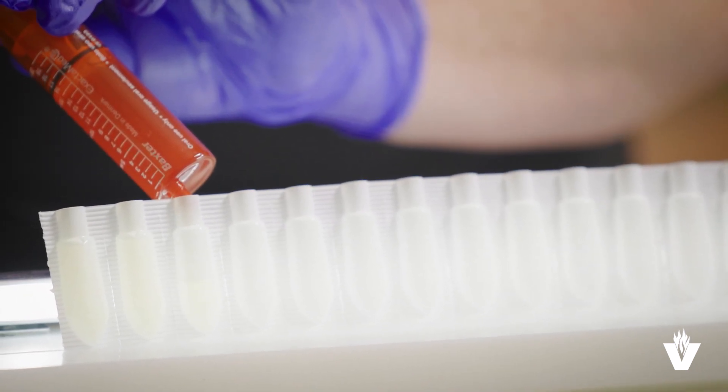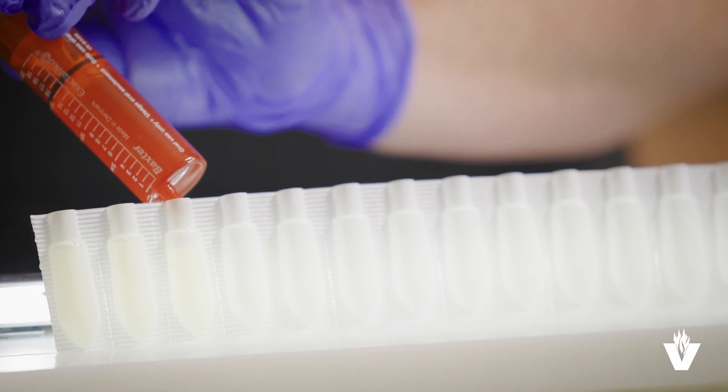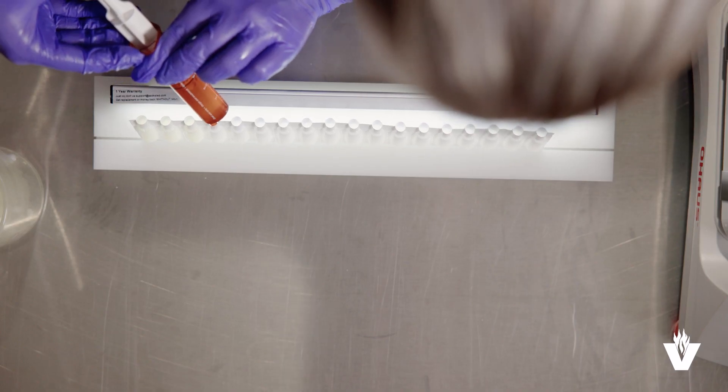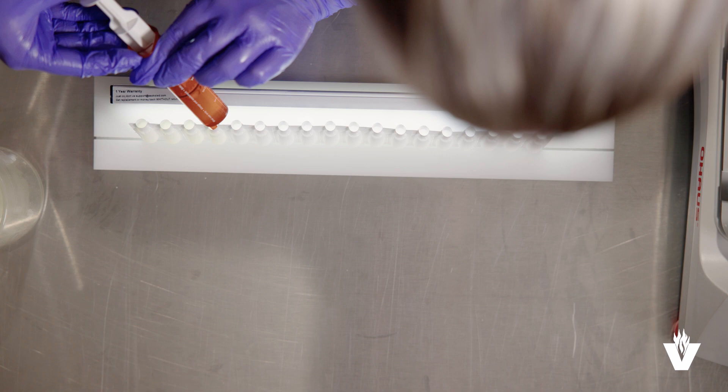You must fill to just above the top line and a certain milliliter because you have to account for the volume contraction as the preparation cools. If the mixture starts to solidify, reheat it to melt it and let it cool again and then finish filling the molds required for the prescription or medication order.